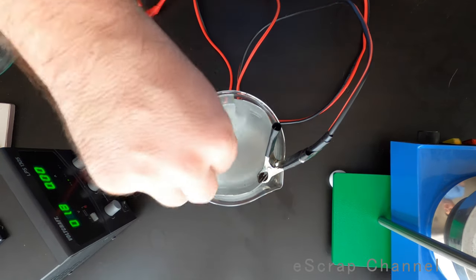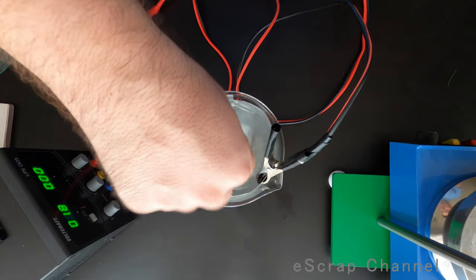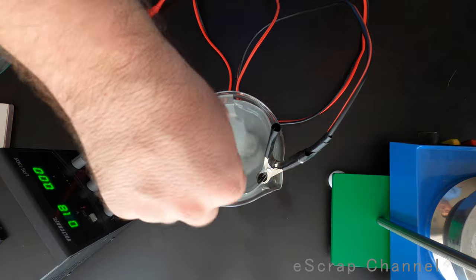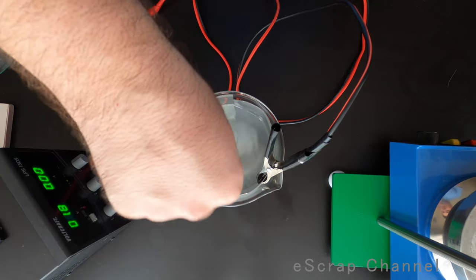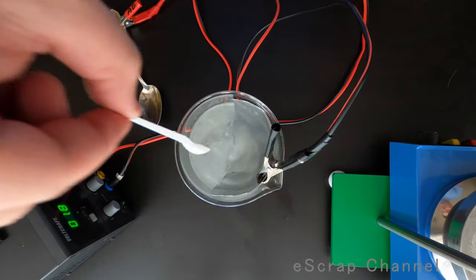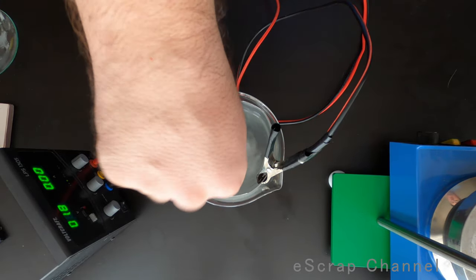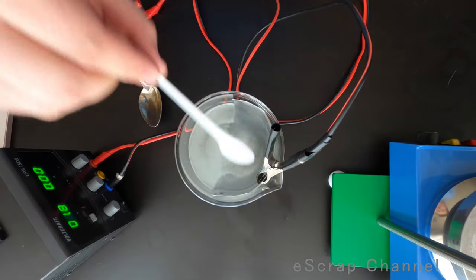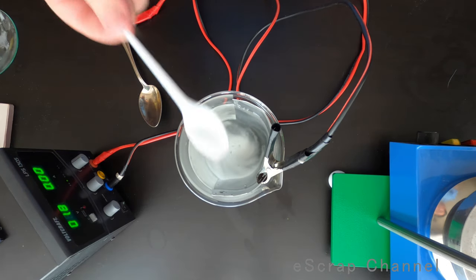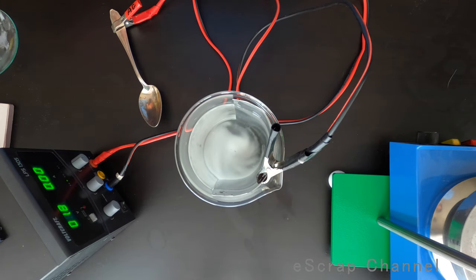So stirring is needed here. I will not use my magnetic stirrer because sodium sulfate relatively quickly dissolves. Almost there. I see only a little bit on the bottom. Here we go. But it will dissolve during the reaction, more or less. It's not critical.